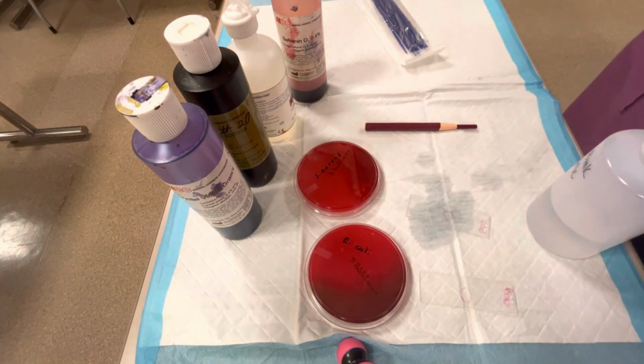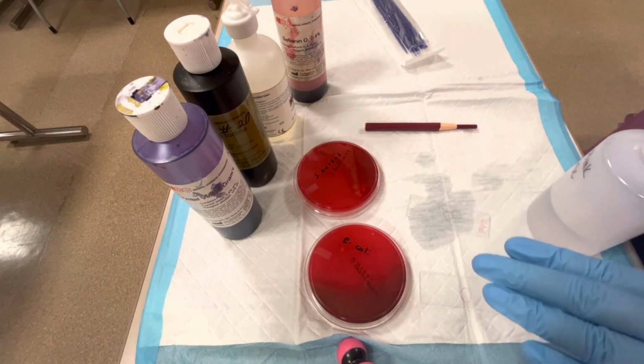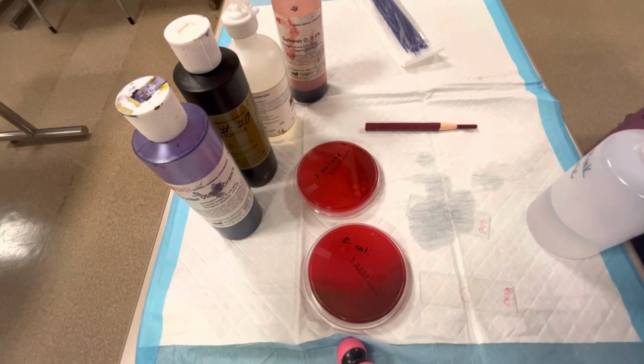All right, so we need to let the sterile water evaporate from these slides and let it dry completely. I usually set a timer for about 10 minutes or so. And then after it is dried completely, we heat fix the bacteria. This allows the stain to work a little bit better on it. So that's the next step. I'm going to let these sit and dry a little bit, and then put them on the heat plate to heat fix. And once that is complete, I will restart the video to show you the staining process.